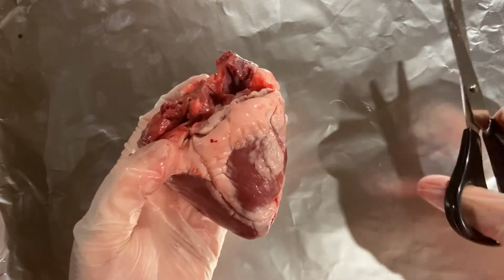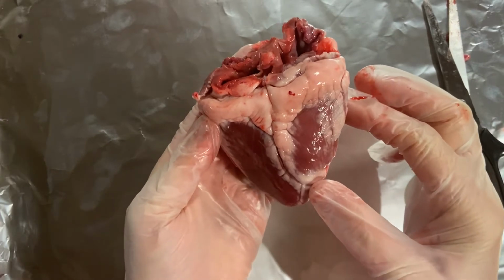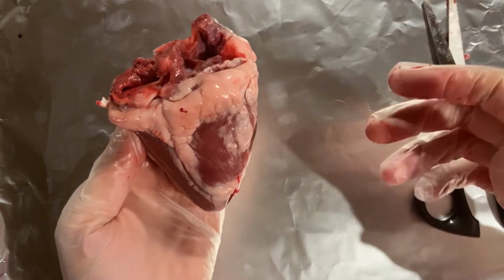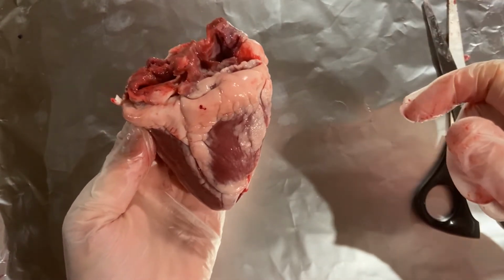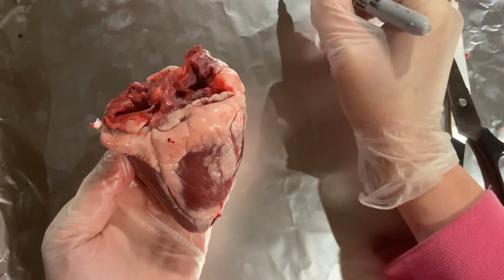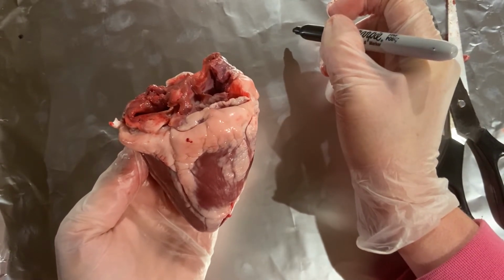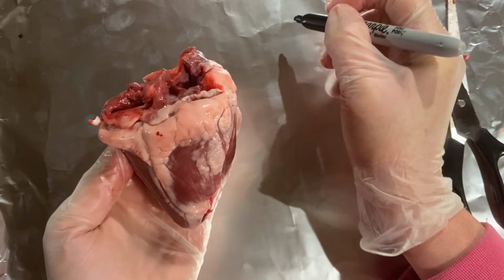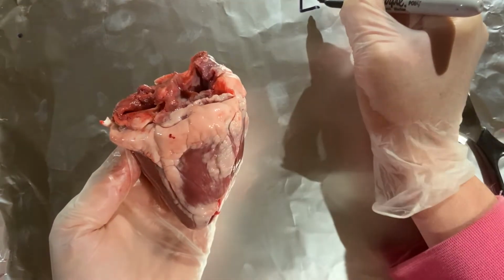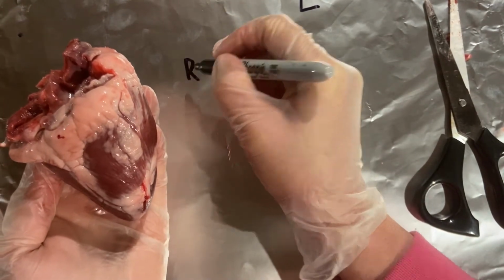Okay. Now, before I cut it further, there's something I want to show you over here. This is how I work out what is the right and the left hand side of the heart. Now, remember, and I'm just going to ask my assistant to get me the pen. Open it up for me, please. Thank you. This over here is my right hand side, but because of us flipping the heart around when we draw it on paper, my right is actually the left, and I'm going to do it down here, and my left is actually the right hand side.